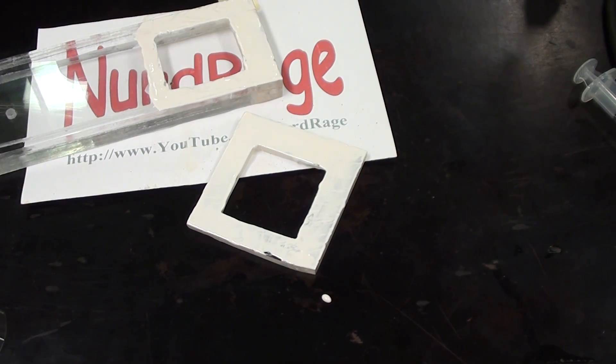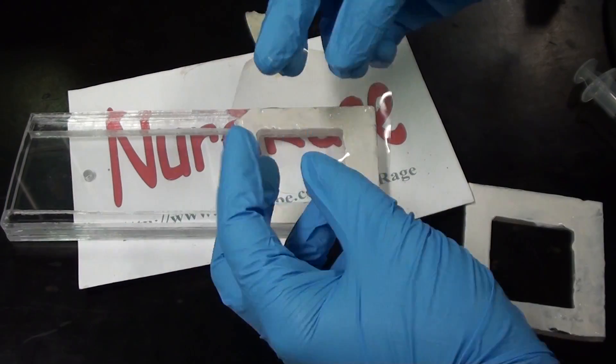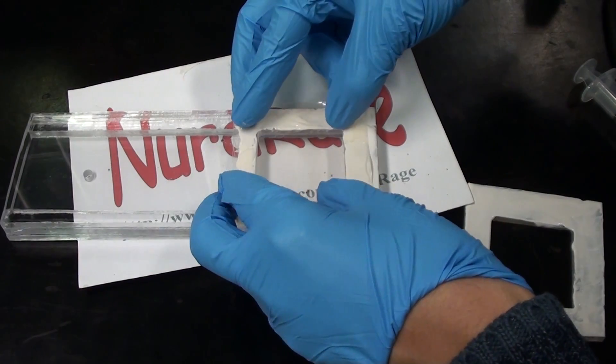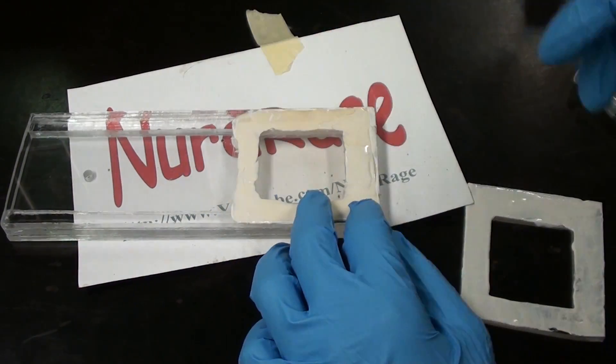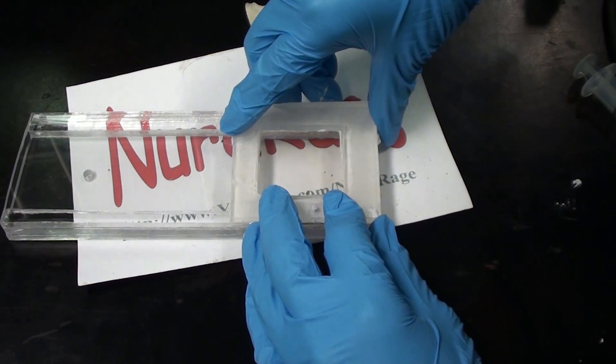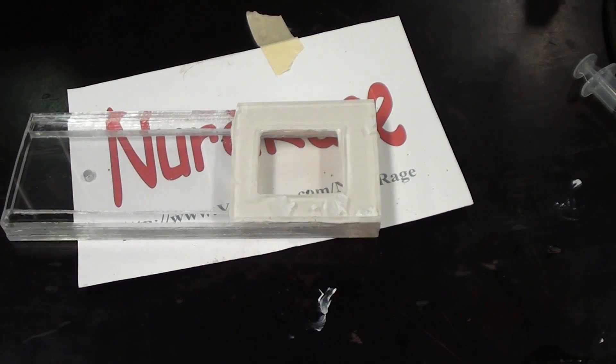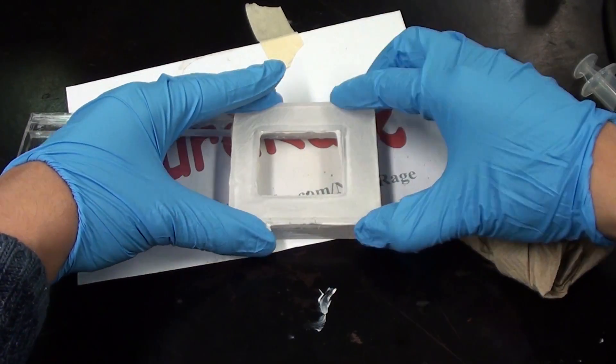Okay so let's place down the membrane and sandwich the pieces. I've already cut the membrane to be slightly smaller than the compartment. And there it is all done, now we just leave it overnight to cure and preferably under some heavy weight so it doesn't slide off.